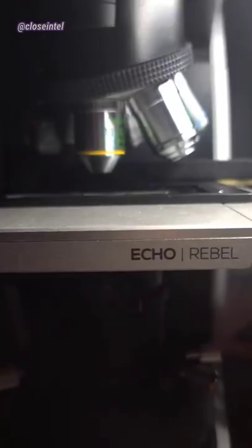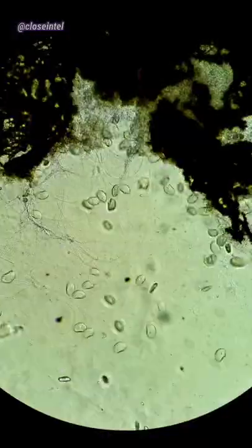As always, we got some really gross stagnant water to test this out on. It's about a month old, and it's been building up with tons of bacteria and cells.